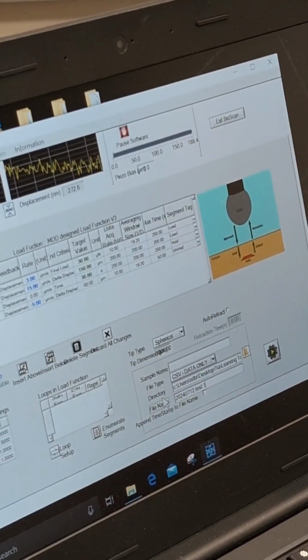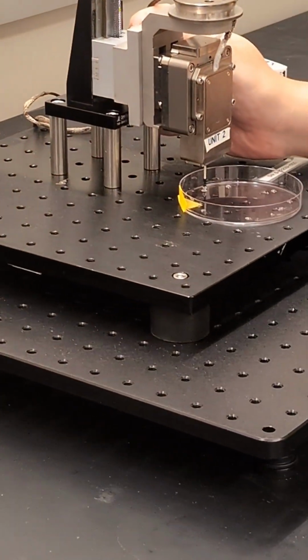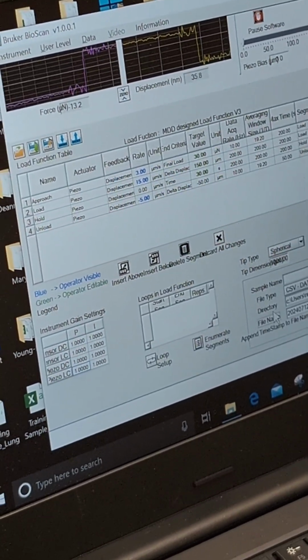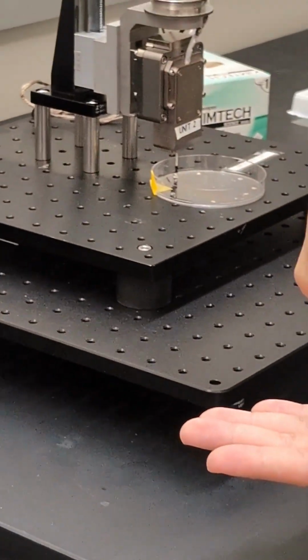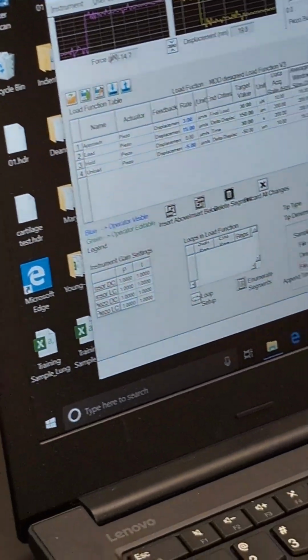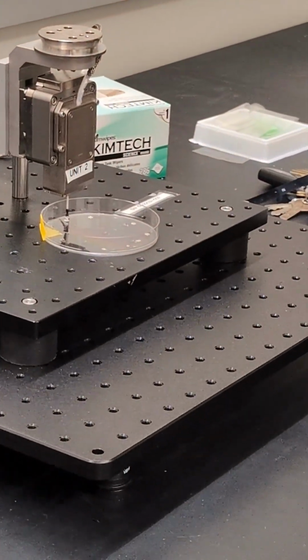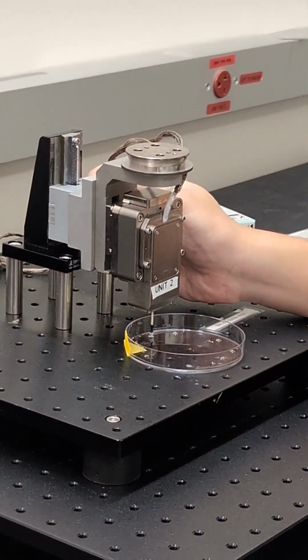So let me reset the probe a little bit. Basically just gently pull it up. I do set the file to allow the machine to pull itself up, but it doesn't move too far away. Basically, I want to have a gentle release. For my hydrogel, it's also very sticky to the point that if you pull it too fast, the counter force will actually yank the whole probe down to the point that it will stop working. It's another major issue I encounter with my work.